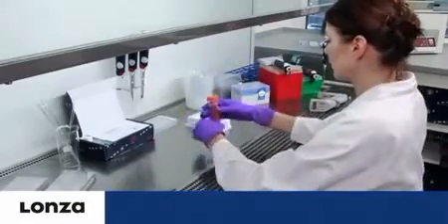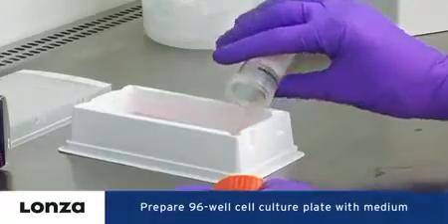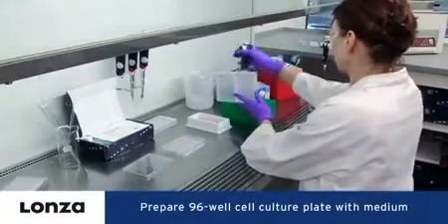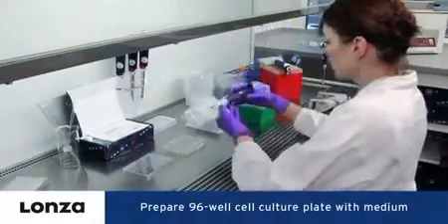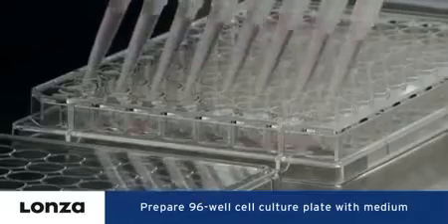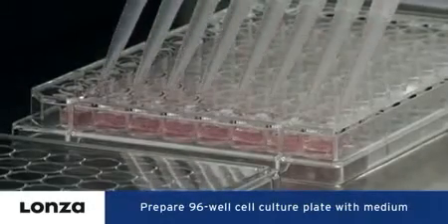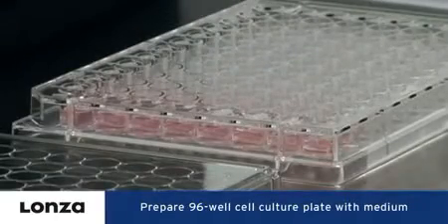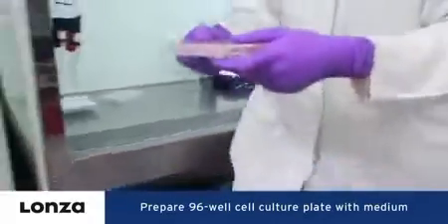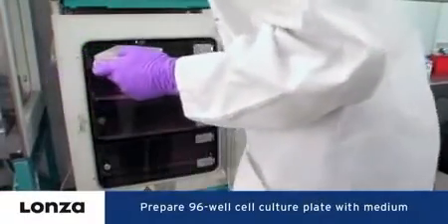Prior to the transfection, a 96-Well culture plate with medium is prepared for the post-Nucleofection cell culture. The plate is then placed in a cell culture incubator to equilibrate with respect to temperature and CO2.